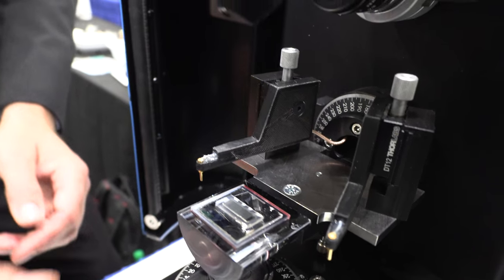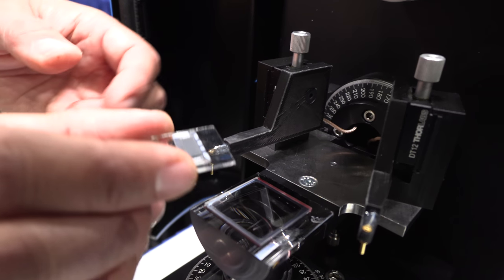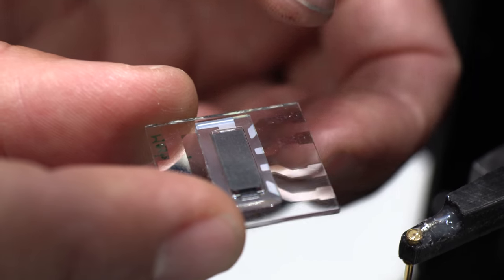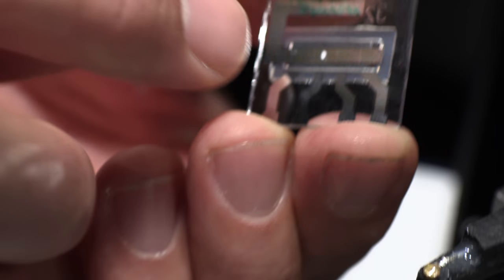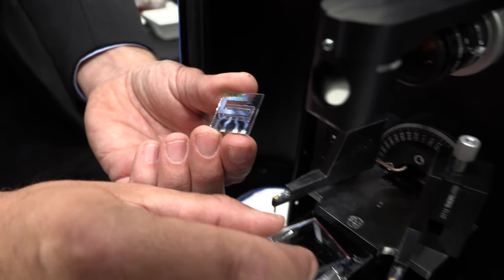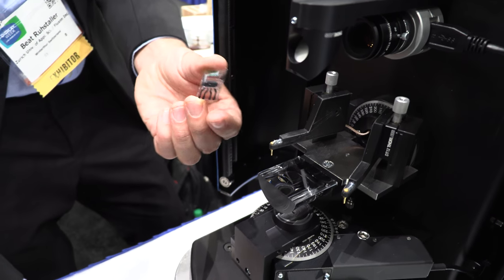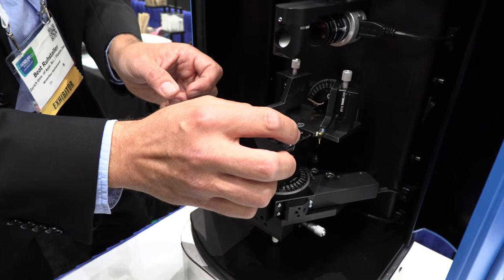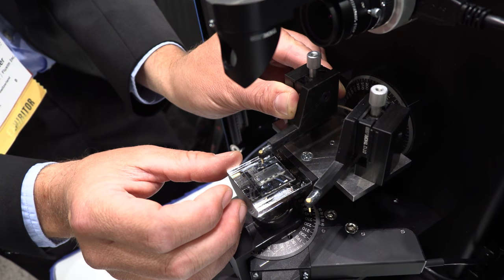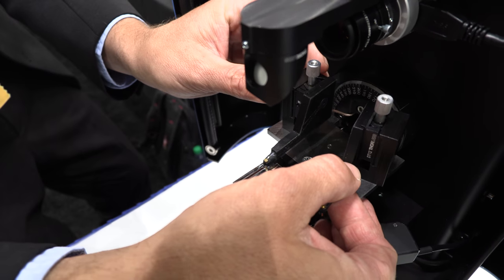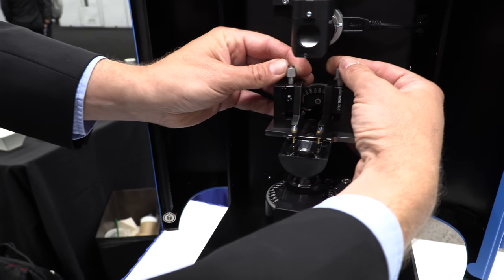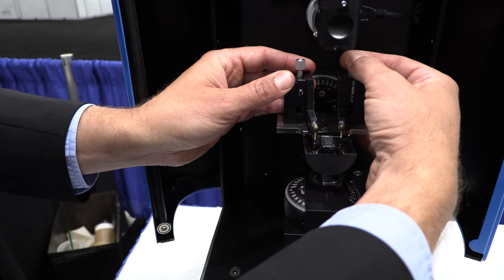Which part is the OLED? It's not so easy to see because there is an encapsulation glass and a metallic cover. Usually if I have an electrical contact then the light would come out from this side. But I would have to remove this sample and then place the OLED here and then make sure to contact the electrical pads. But now I would need still to change the vertical position here in order to touch these pads.